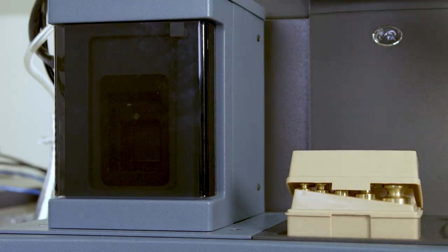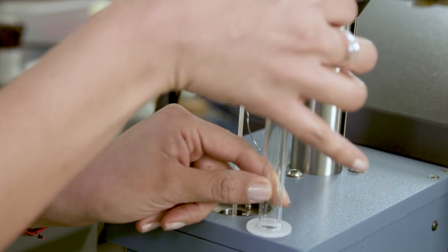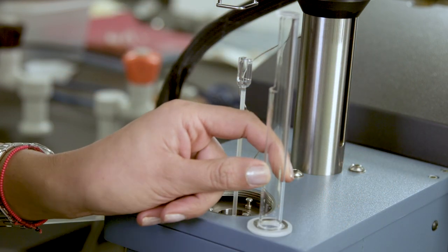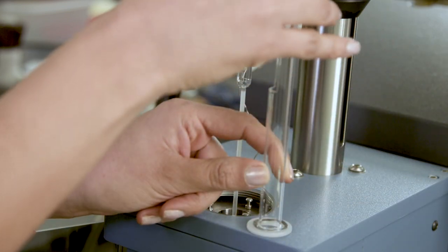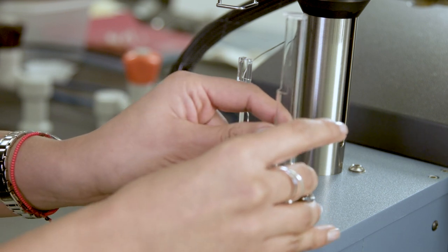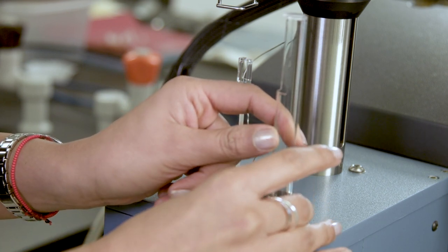Close the weight tray door. Place the wave washer down over the top of the stage so it sits on the flange. Slide the stage retainer ring down over the top of the stage such that it rests on top of the wave washer.